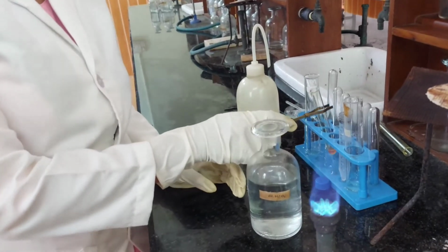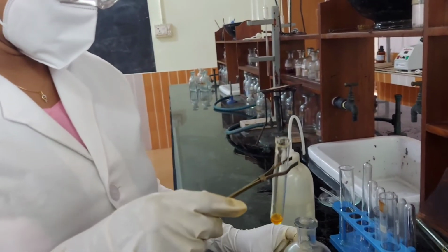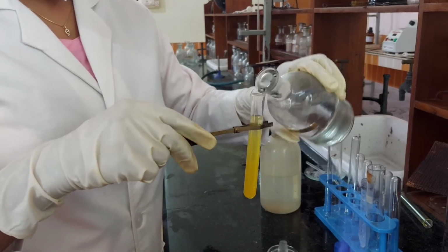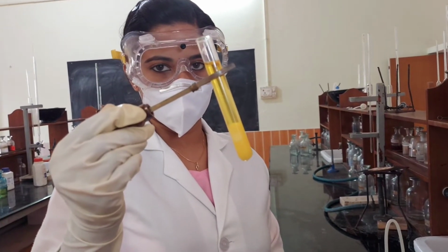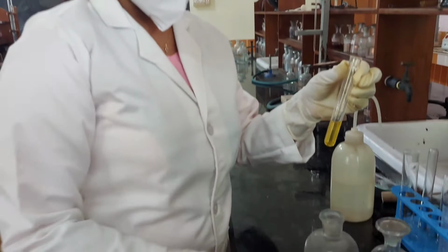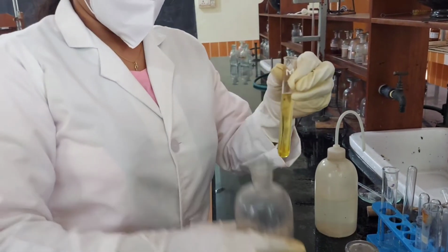In the presence of strontium, to the second portion of the centrifugate, excess of dilute H2SO4 is added. A precipitate is formed which is removed. To the solution left, excess of ammonium hydroxide is added, followed by ammonium oxalate solution.